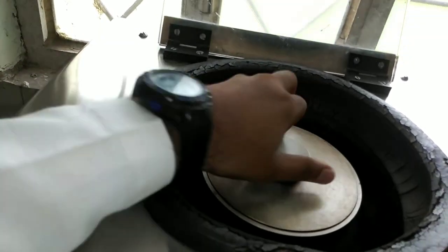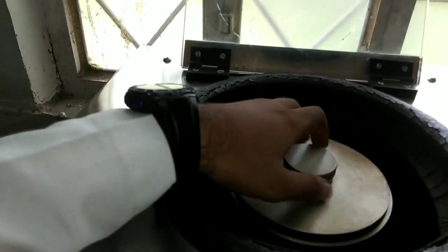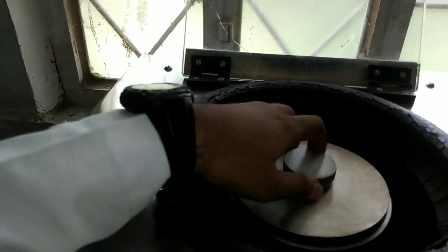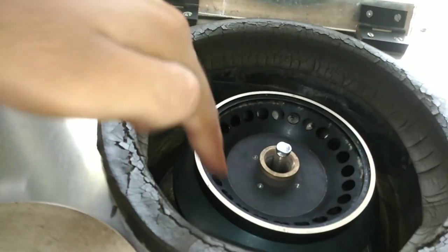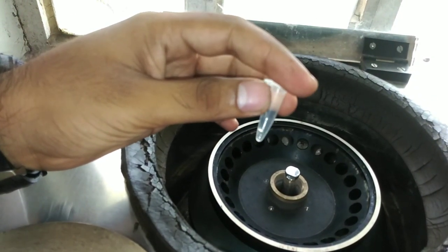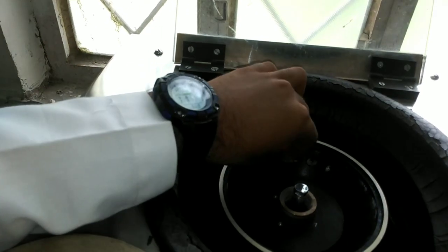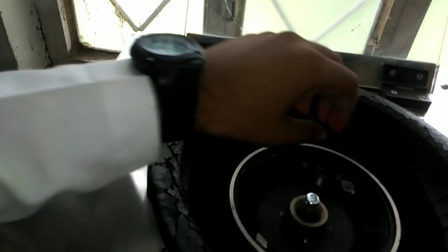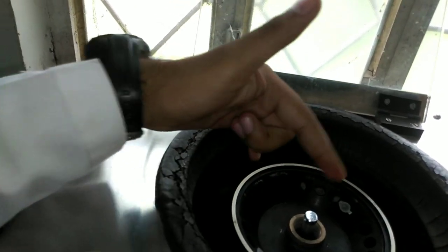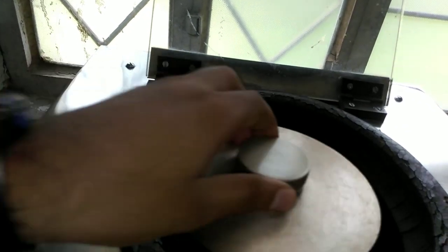As you can see, this is the inside of the machine where the tubes — the Eppendorf tubes — are kept. Let's see how centrifugation is done. First, open it up. You can see there are many slots here — these are the points where we fit the Eppendorf centrifuge tubes. They are small tubes that you place in the slots. You must balance them — place tubes opposite to each other — because the machine works on centrifugal force, so no imbalance is allowed.